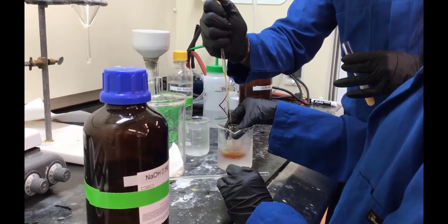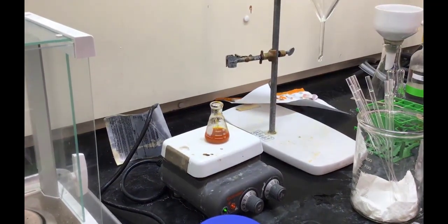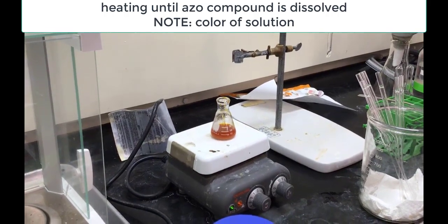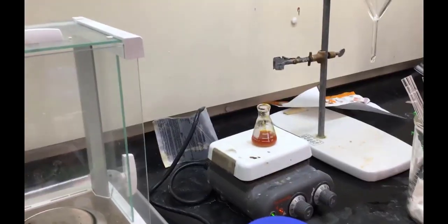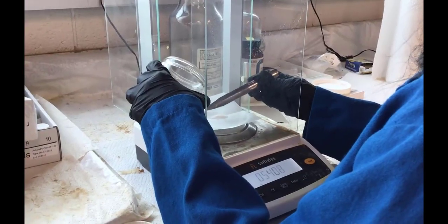Right, and so this entire process of doing the slow addition and shaking took about 10 minutes. And so now this azo compound mixture, or this mixture to give you the azo compound, is now going to be heated on a hot plate until all of this precipitate that formed is dissolved.